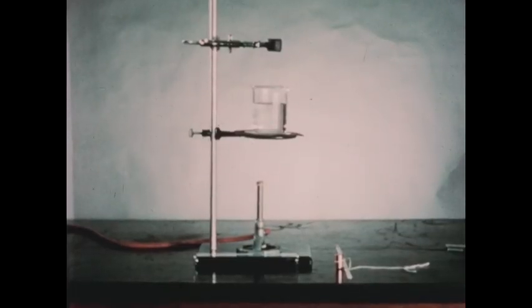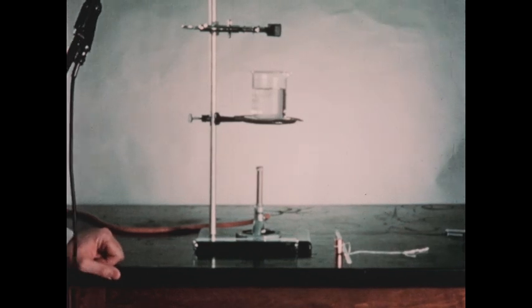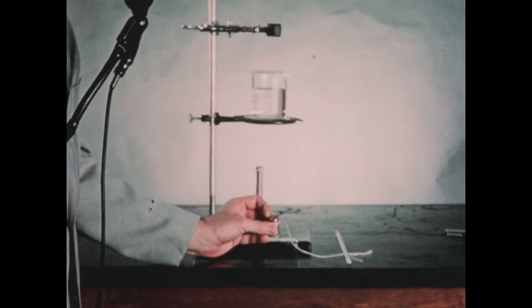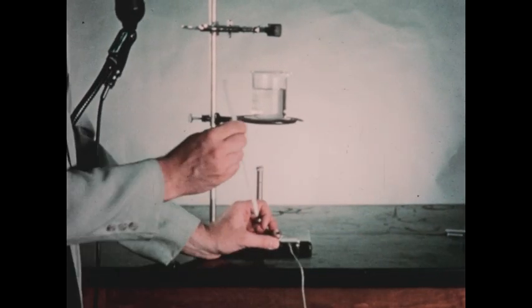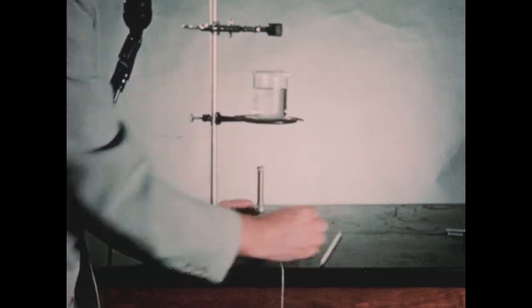We must now heat the sample of copper to a fairly high temperature and then also measure that temperature accurately. We've tied a piece of string around the copper so that we can lower it into a test tube. You'll notice that the top of the copper block has a small hole drilled in it, which permits us to insert a thermometer into the copper block.